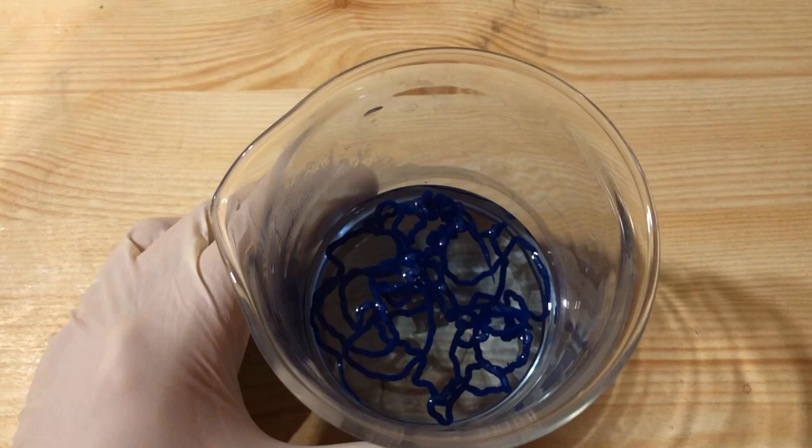The artificial silk thread remains in the sodium hydroxide solution for 15 minutes to cure completely.